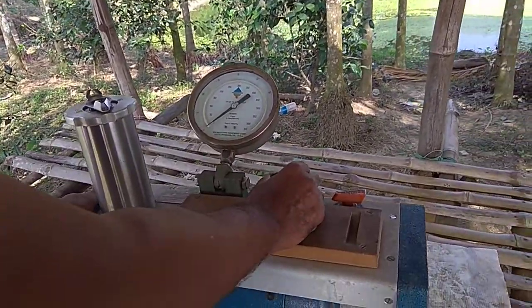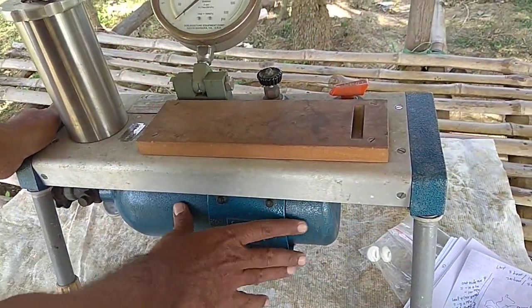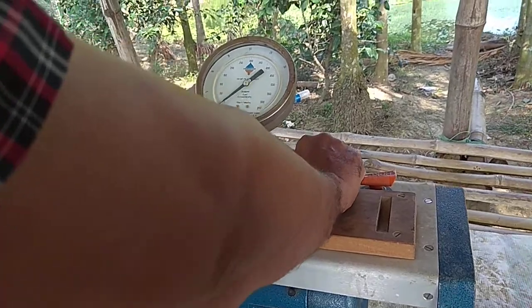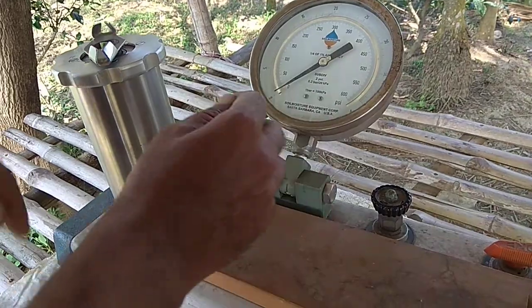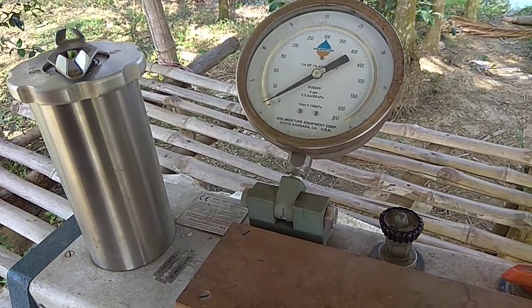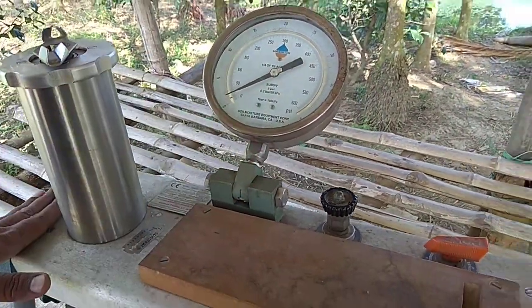So this is again the valve. We have now started the gas from this cylinder to the chamber, and you can see on the pressure gauge that the pressure is going to increase. So you release the gas slowly. If the pressure increases too fast, it will create a problem and we are not getting the reading. So that's why we have to increase the pressure slowly.